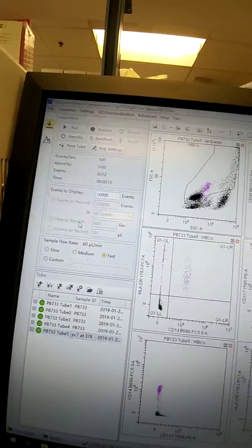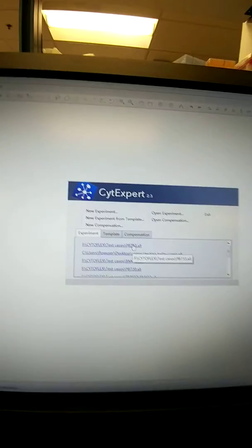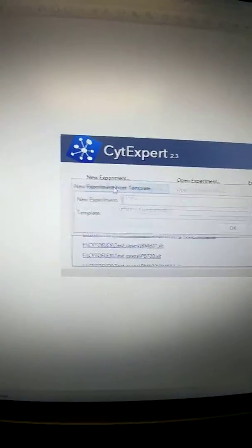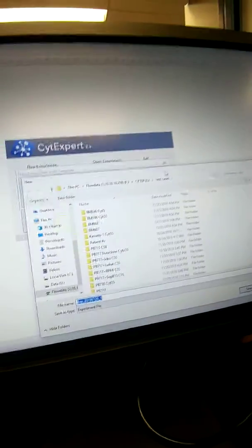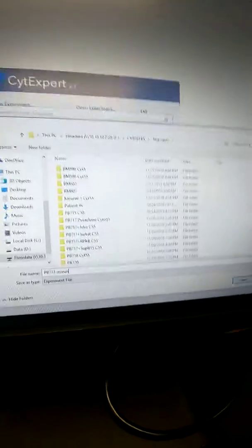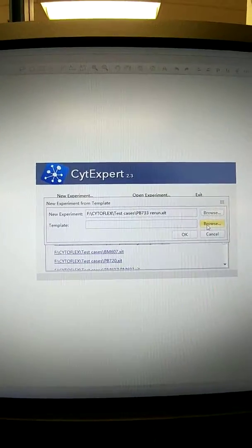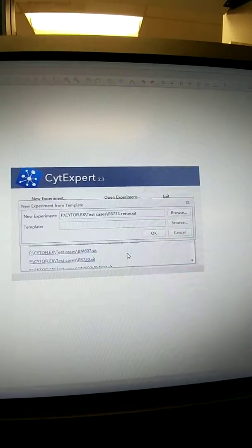We can do file, close experiment. Okay, I'm going to go ahead and hit yes to save this just in case. Okay, so now if we wanted to do a new experiment from template, okay, we could name it. I'm just going to leave it as, let's see, PB733 rerun or repeat or whatever you want to call it. Okay, save. And it should show up here in a minute, and then browse and open your template.